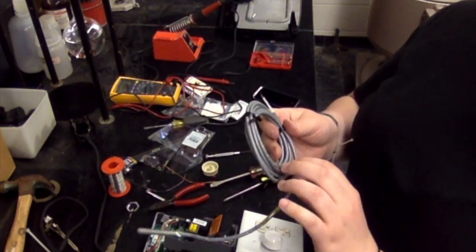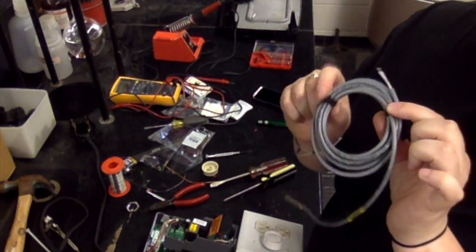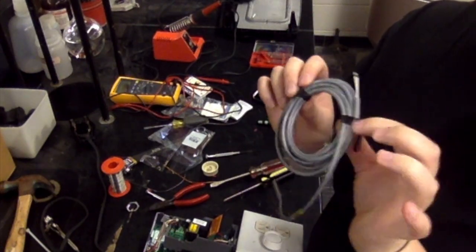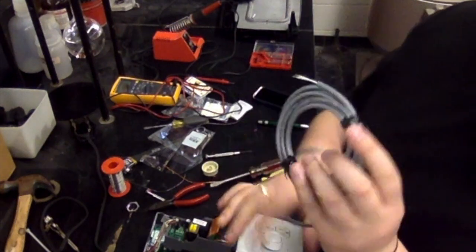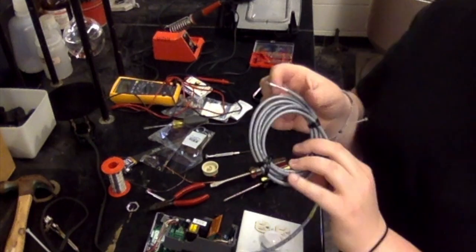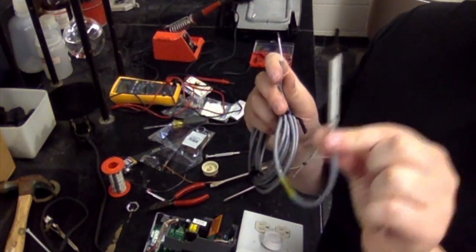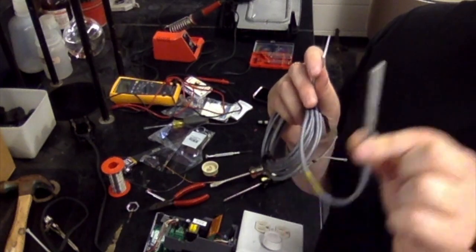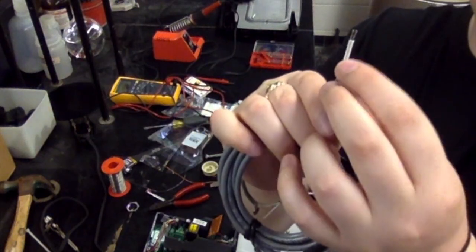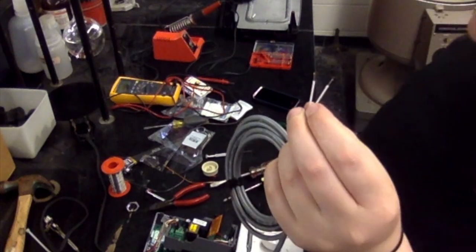You're not going to need to use all this length, so I would maybe not take it out of the little twisty ties here because it'll just make it a lot nicer and neater whenever you go to use it in the lab. With this thermocouple, you'll see this is the thermocouple end, right? So this is what's going to go into the sleeve that goes to the griddle that heats the unit. This piece, or this end that has 2 leads here, is what we're connecting to A419.